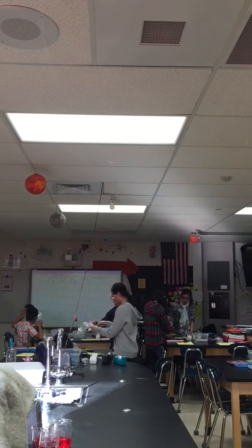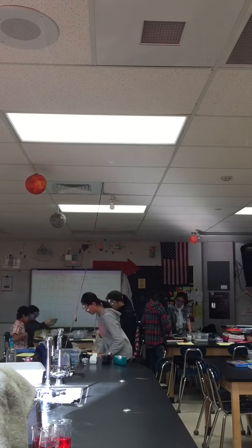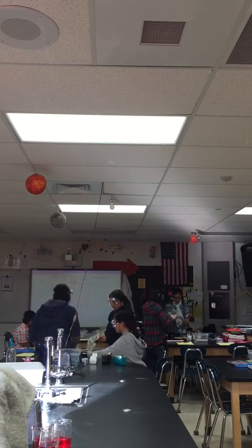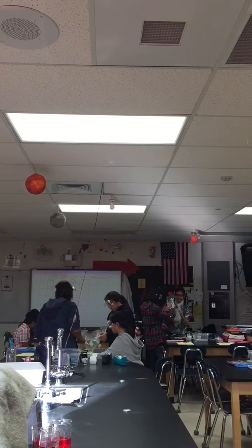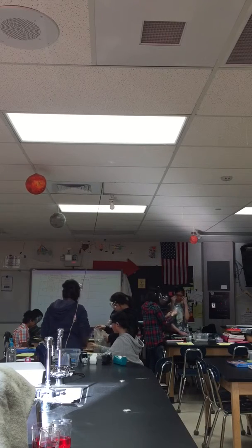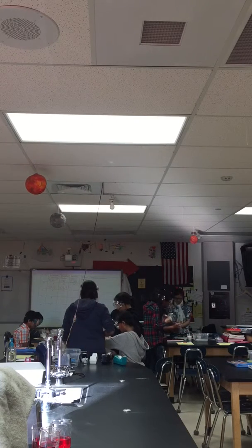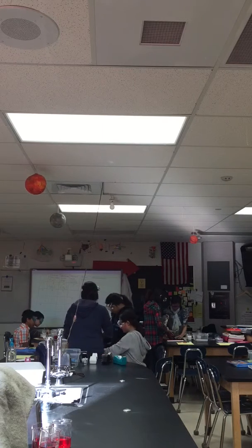Wait, what are we using that for? Oh yeah, I know. 3, 2, 1. Yellow color. Yep, so you're ready to go now, pour it in. We're going to seal it. Get all the air out. Keep sealing it. Completely sealed. Okay, what do we see? Let it go. Mix everything together now.